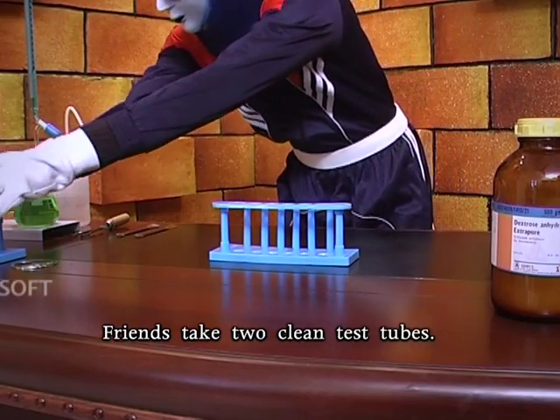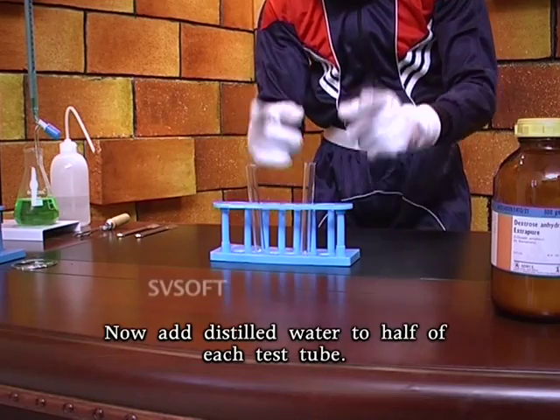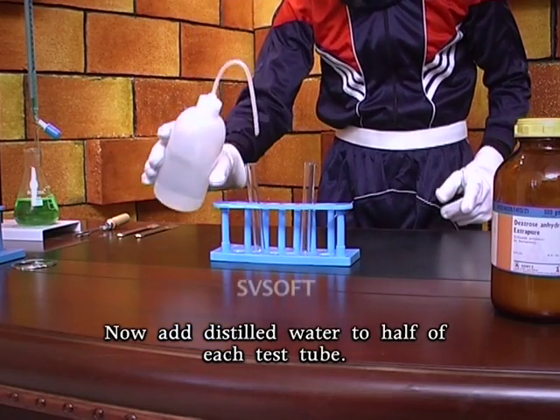Friends, take 2 clean test tubes. These test tubes were placed in a stand like this. Now add distilled water to half of each test tube.